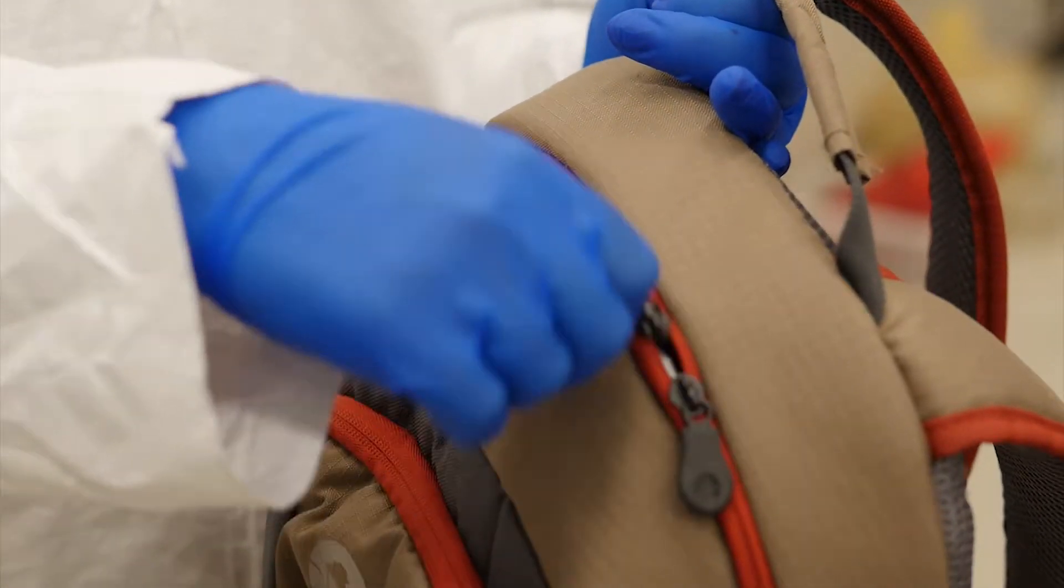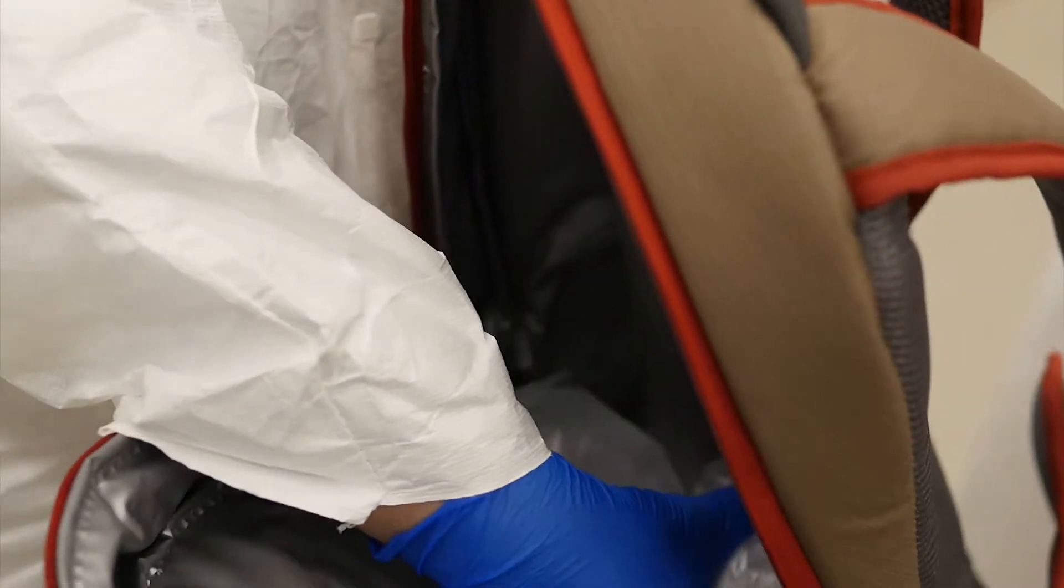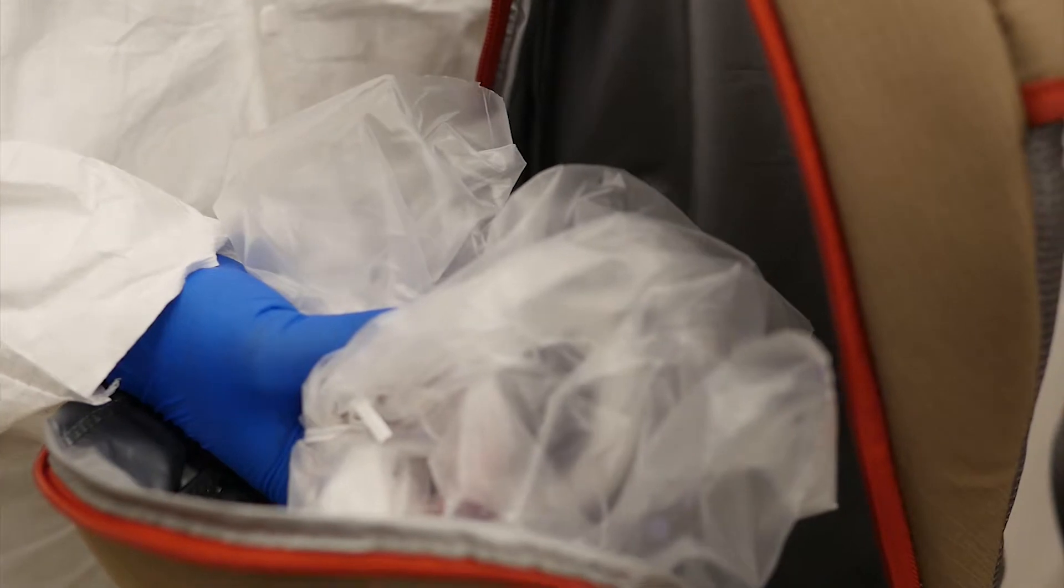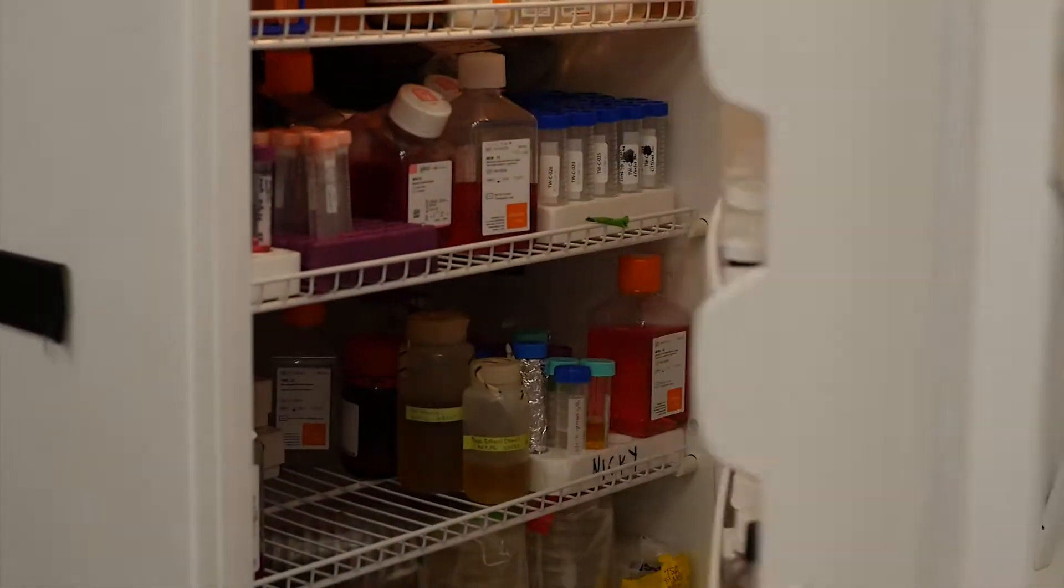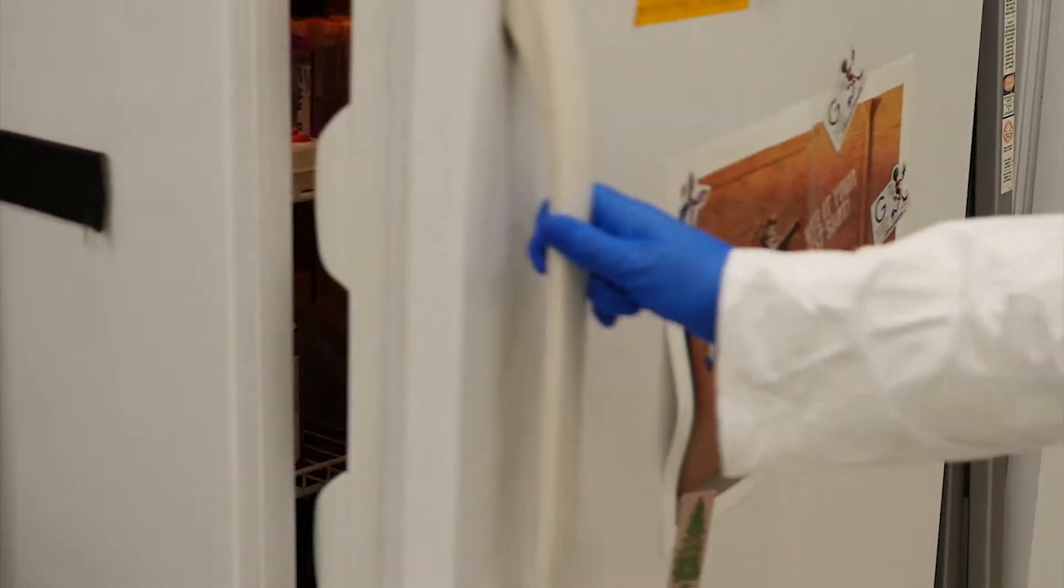After filtration, the ViroCap filter is transported with cold packs to the laboratory for elution. The sample should be eluted immediately. If elution cannot be completed immediately, store the sample at 4 degrees Celsius for up to seven days post-filtration.